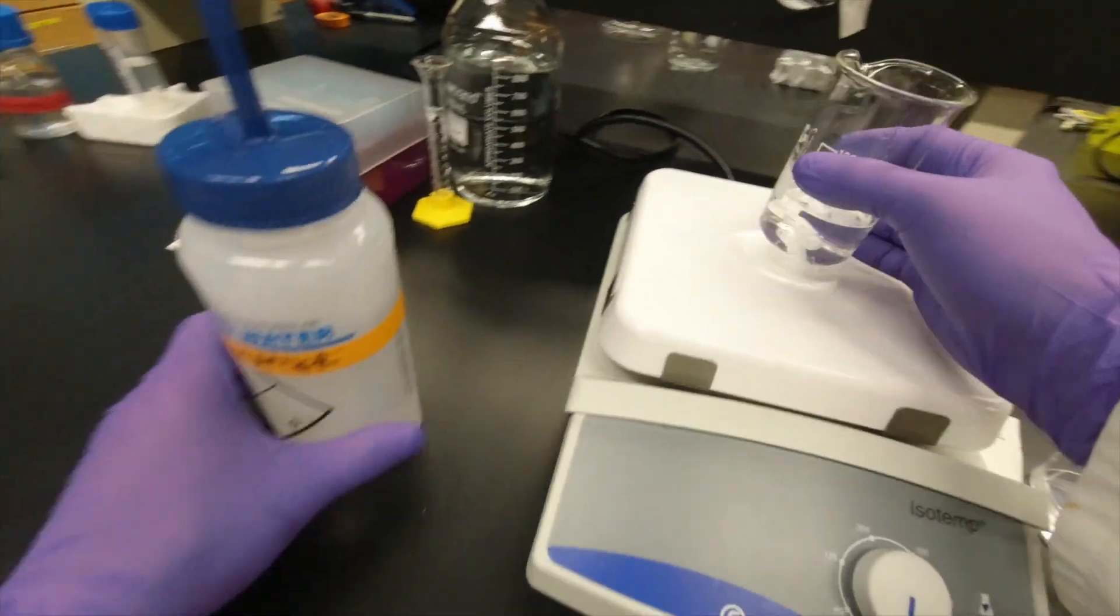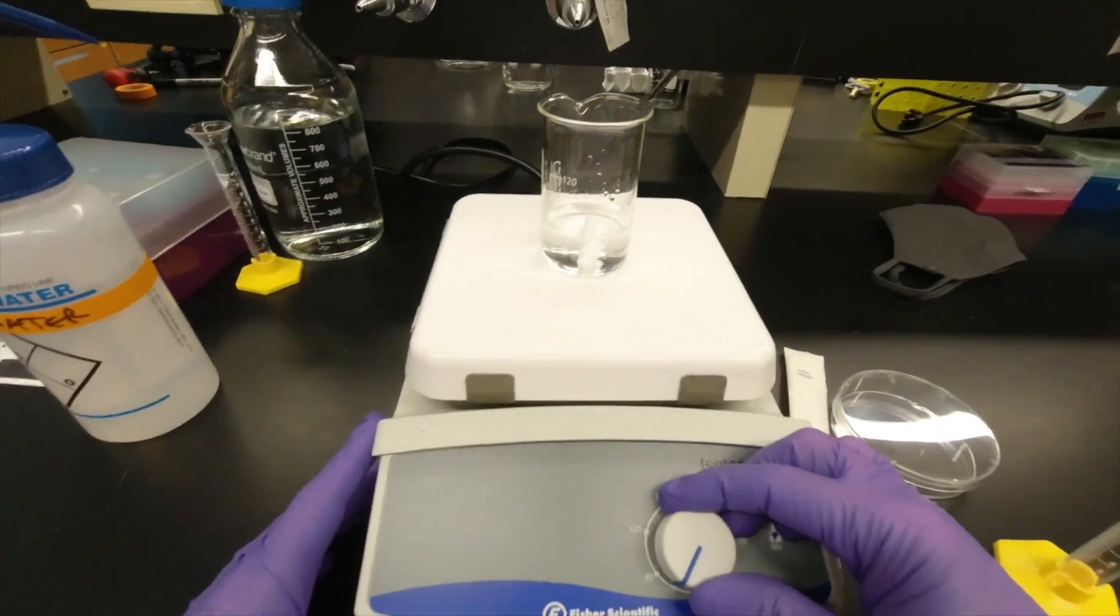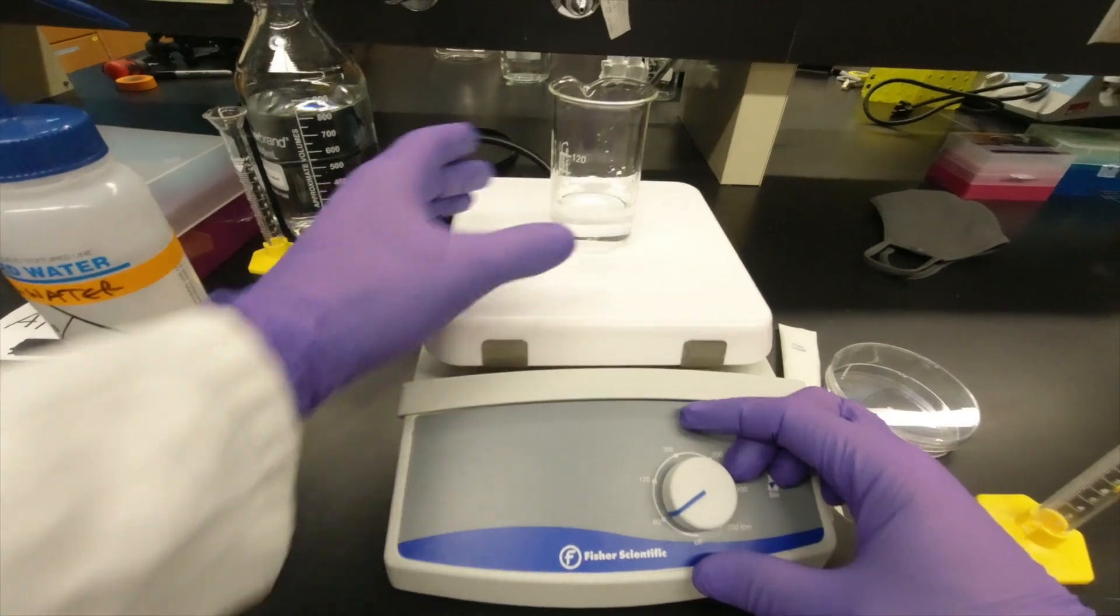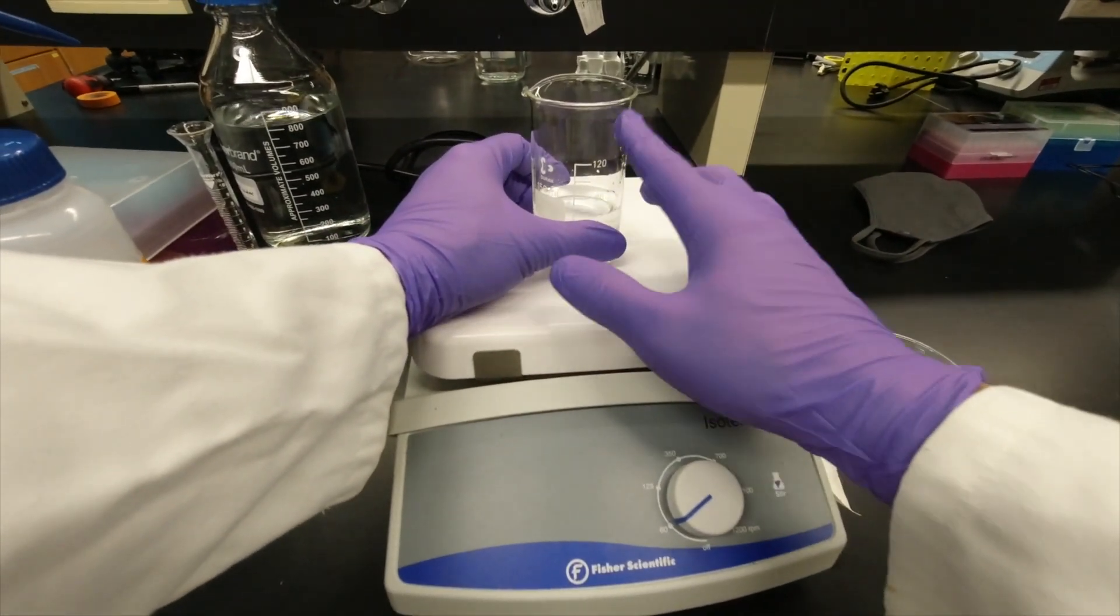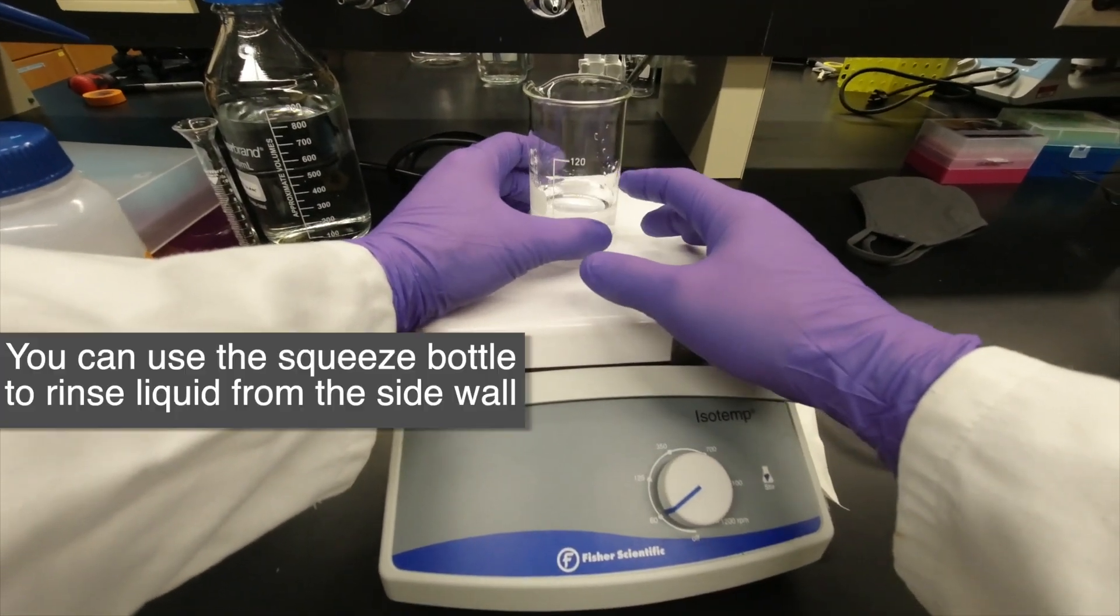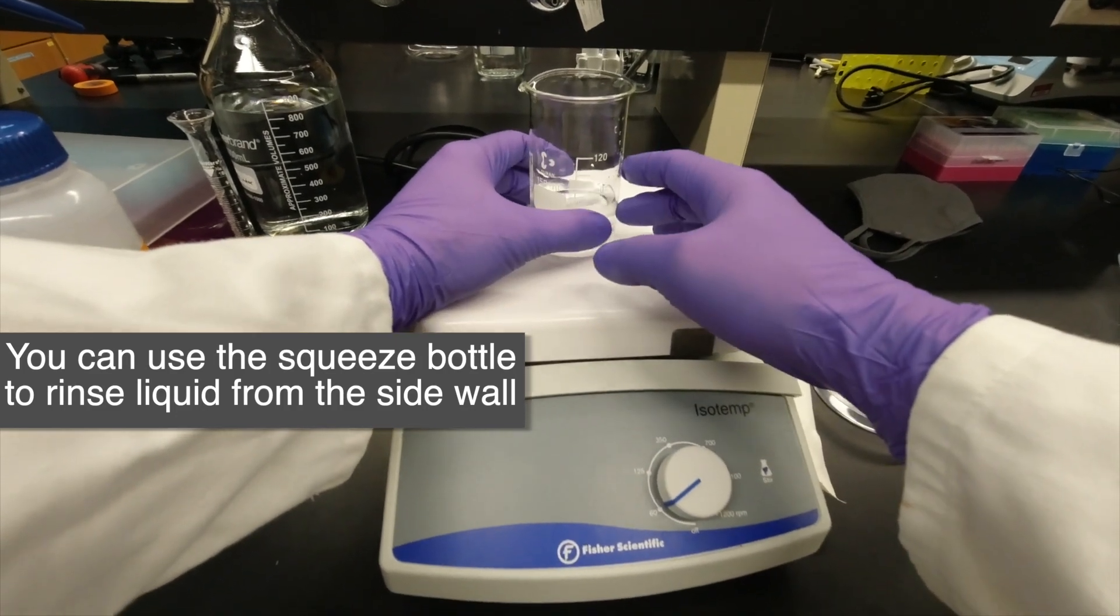So the next thing to do is to get this very slowly. Nice and slow. Now look what we've got here. So hopefully that's just water, right? We don't want that to be phosphoric acid.